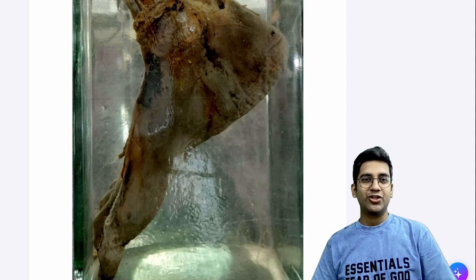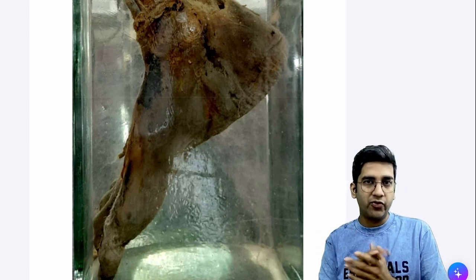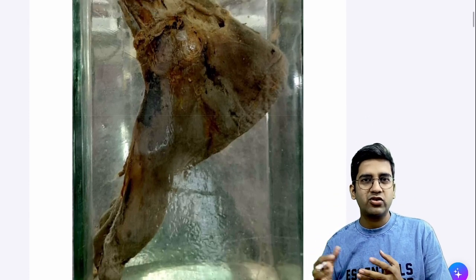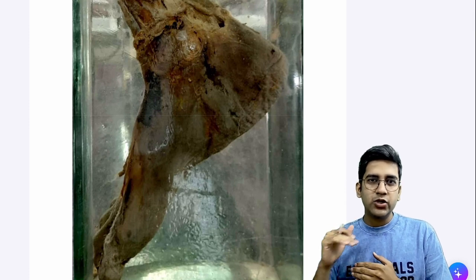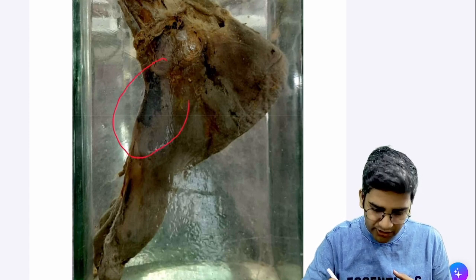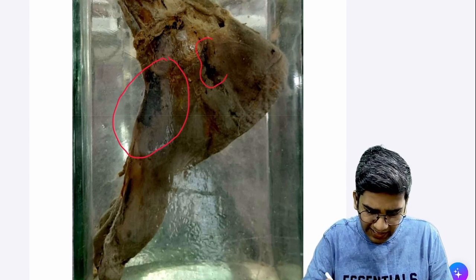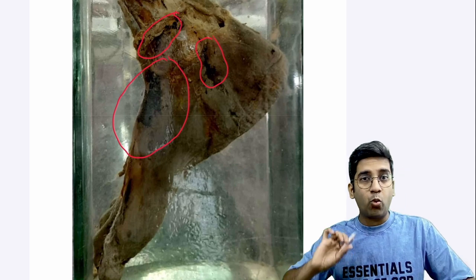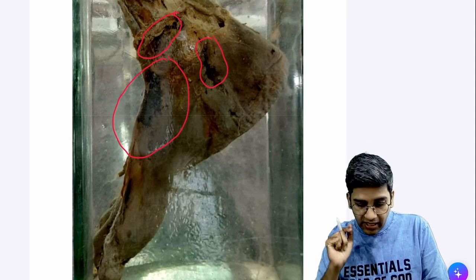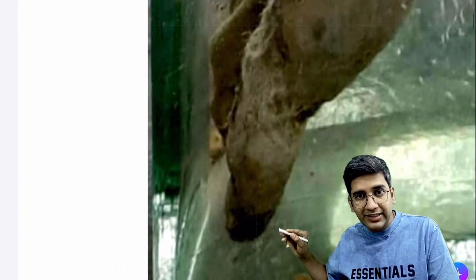So this is a specimen of a foot with all the toes, most likely from an amputation process. You can see an ulcerated area over the skin — I'm not exactly sure about this, as it may be a post-processing artifact. There are a few areas of blackish discoloration, and gangrene will not happen in patches. If you look at the toes — I'll zoom into this part — you can see that the tip of the toe is completely discolored.